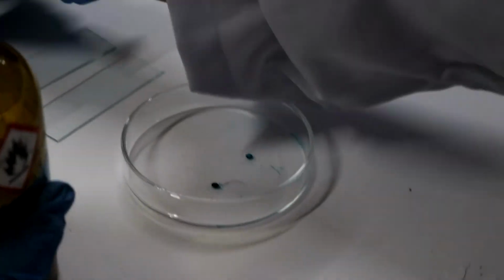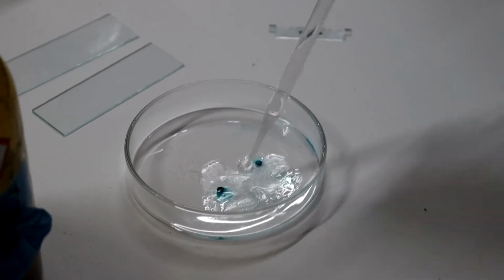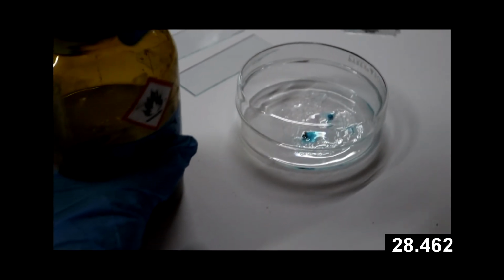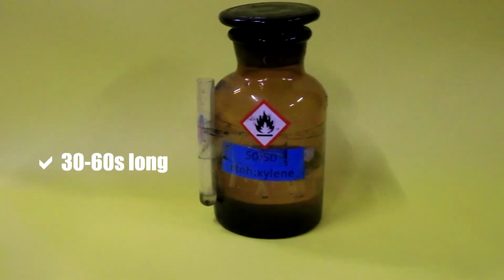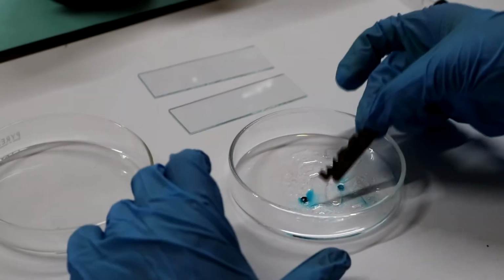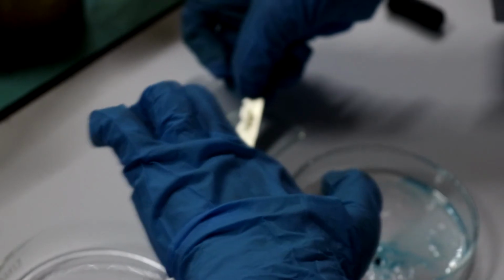After washing, transfer them in a 50-50 mixture of absolute alcohol and xylene. It is advisable to do this under the fume hood because xylene fumes should not be inhaled. Then after placing them in this mixture, transfer the sections in xylene and let them stay for 10 minutes.